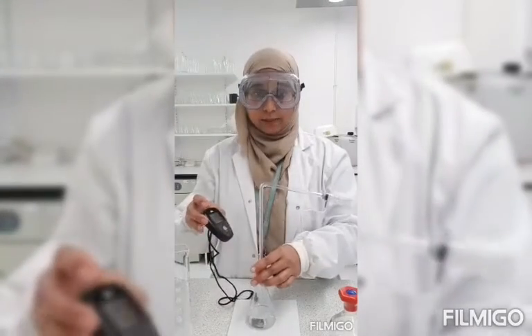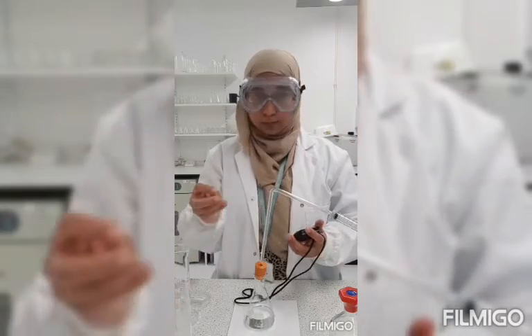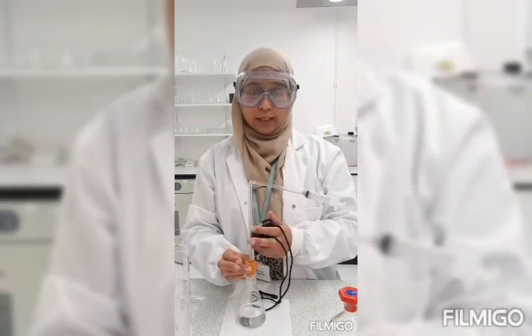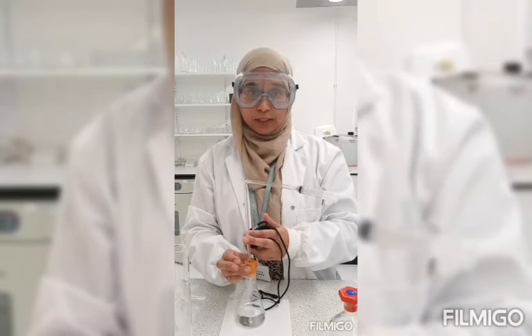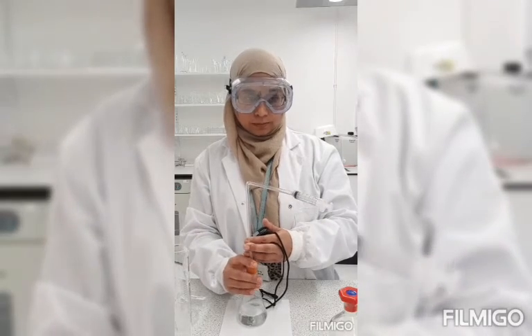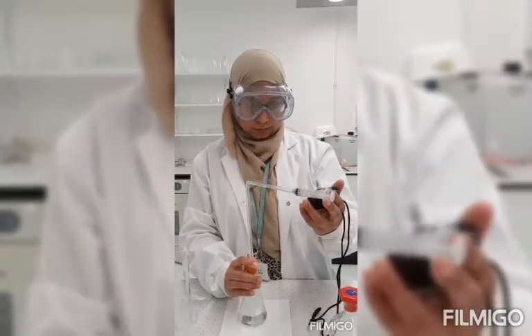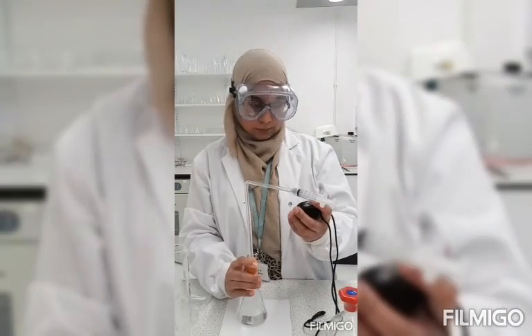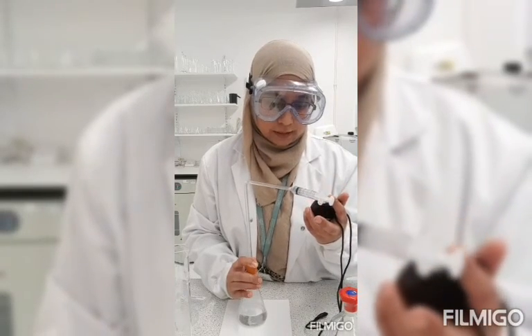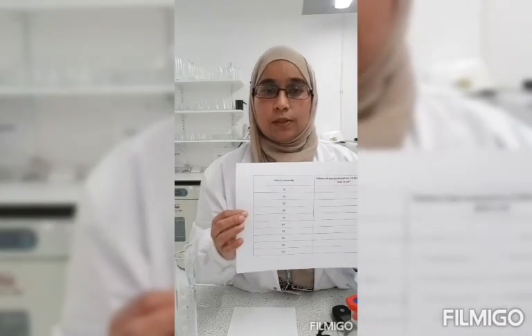Get my stopwatch ready. Put my magnesium strip in, and then I will start my stopwatch. And you can see the amount of gas being produced in the syringe. So every 10 seconds I will see how many milliliters of gas is being produced, and I will record that on my table. Using my results, I can then make a graph.